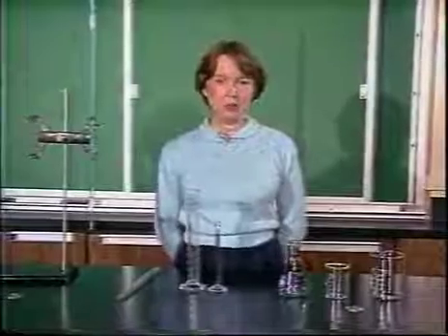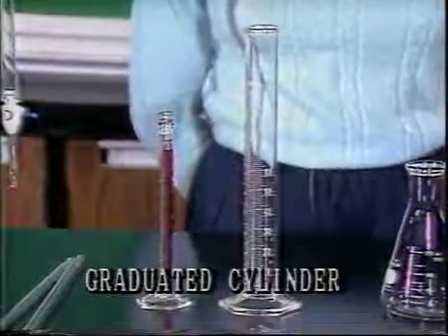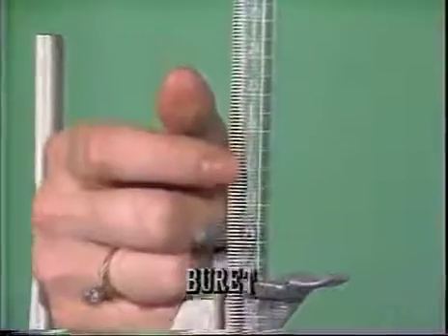Today we look at a couple of these. They include graduated cylinders, pipettes, and a burette. By using the proper glassware and being very careful, it is possible to accurately measure volumes of liquids.